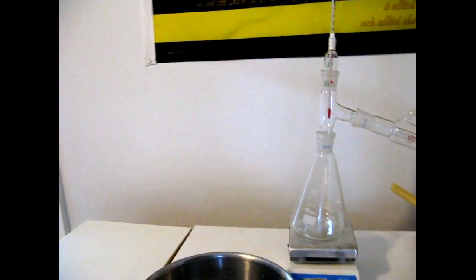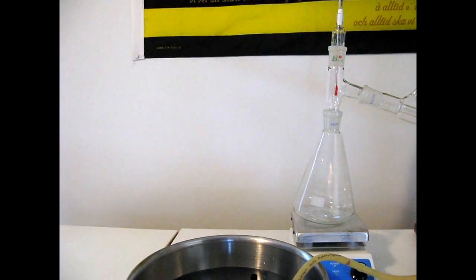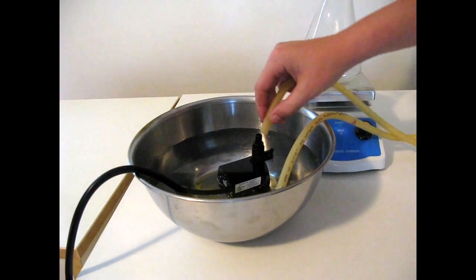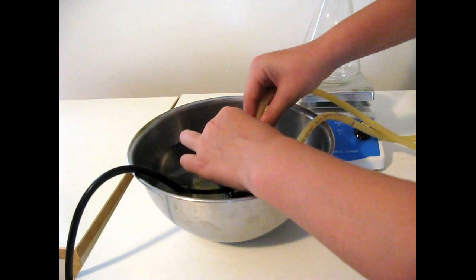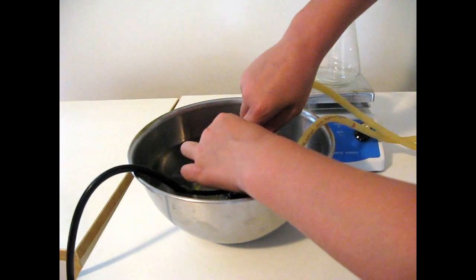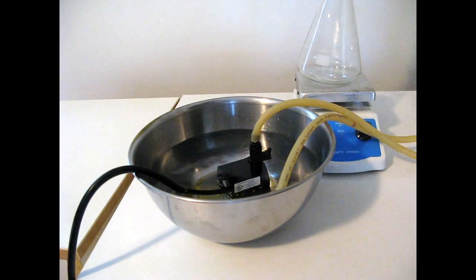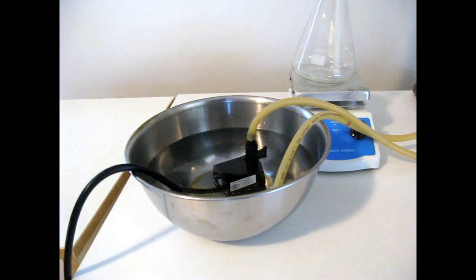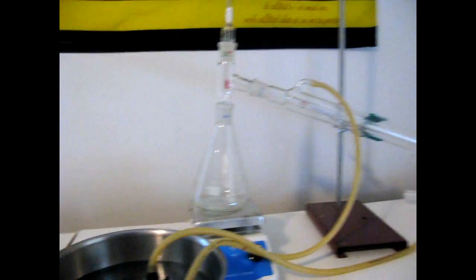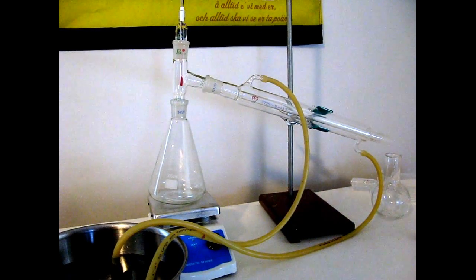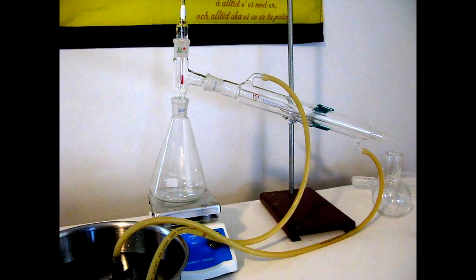So, just a second, let me adjust the camera. And it will go into your pump. I have a very small and not very powerful pump here. That is actually exactly what I want so I don't flood my condenser and have it shatter under this stress.